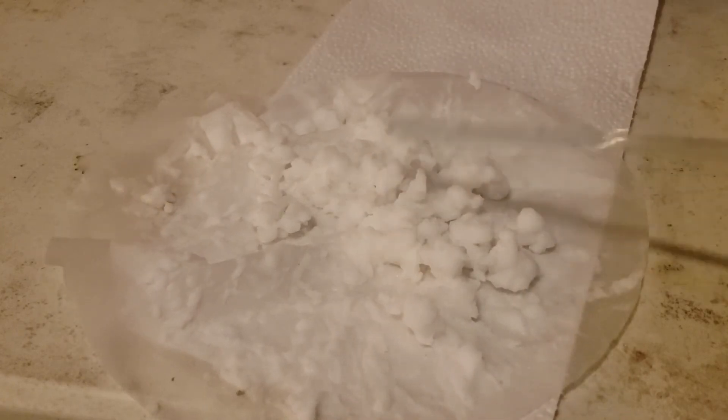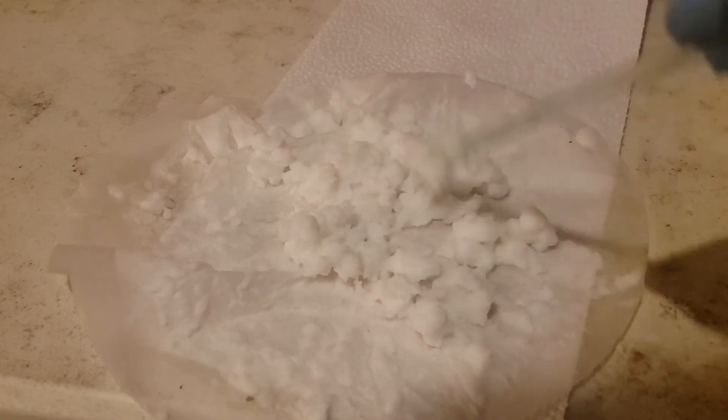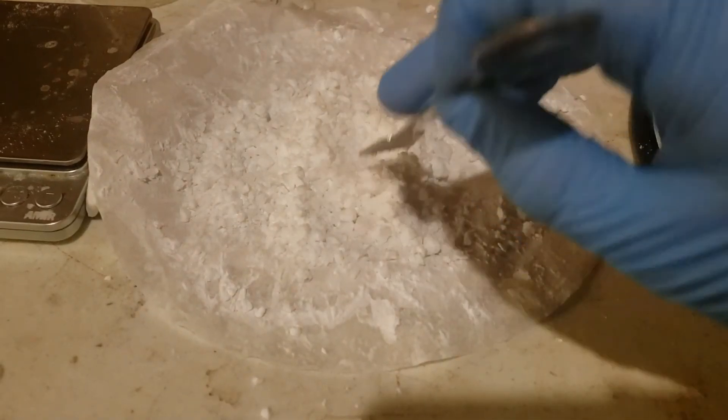Over the course of a few days, the boric acid slowly dried out, and after around 2 days, we got an almost completely dry product.